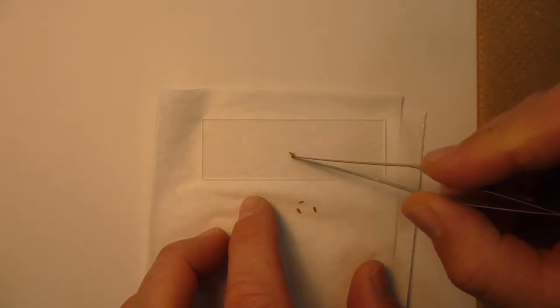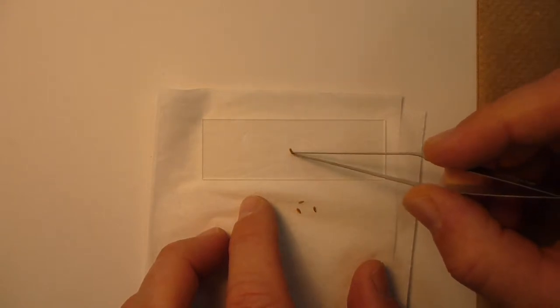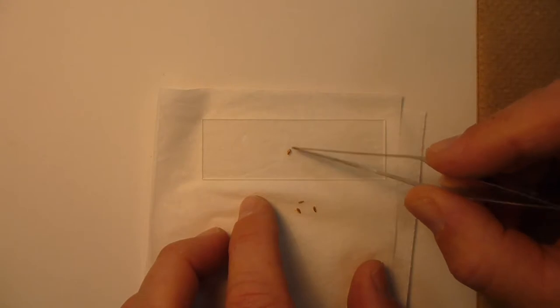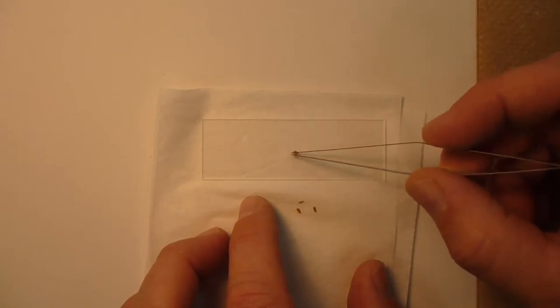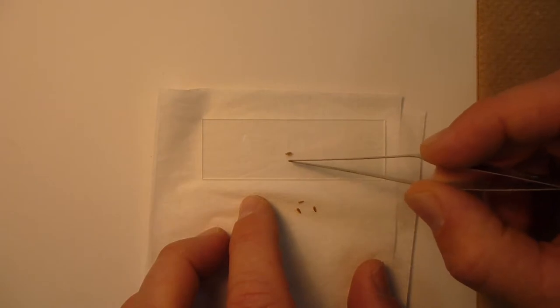You're not going to have a whole lot of control over how it ends up appearing at the end. So you try and do the best that you can initially. This one, of course, is not cooperating with me. I'll try and get the head off to the left.